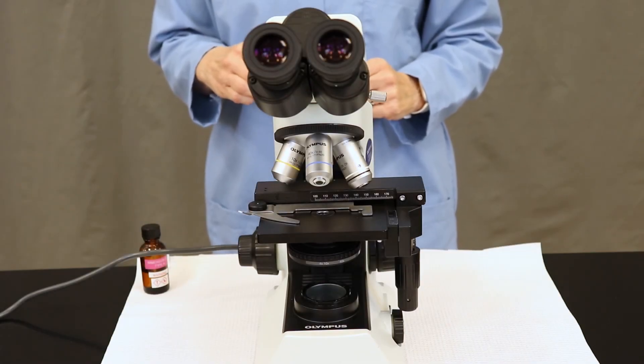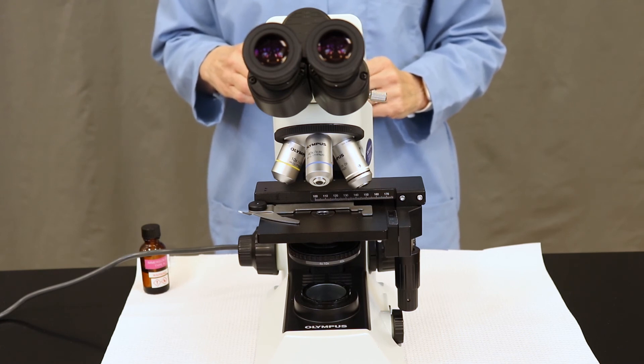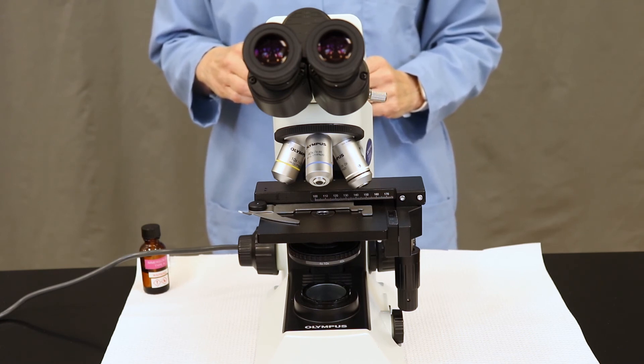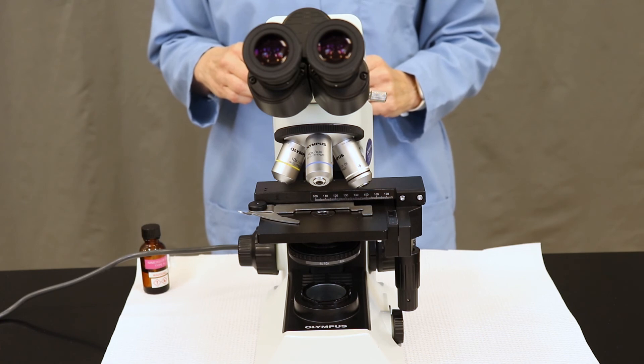Welcome to Bio 205 Microbiology at Pima Community College. In this video we're going to demonstrate use and care of the microscope that we would find in our classes.